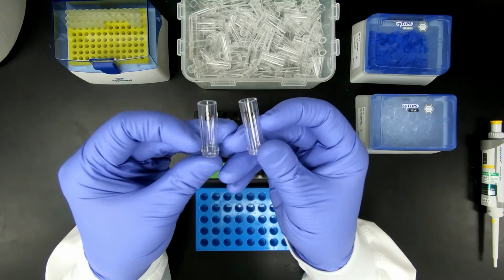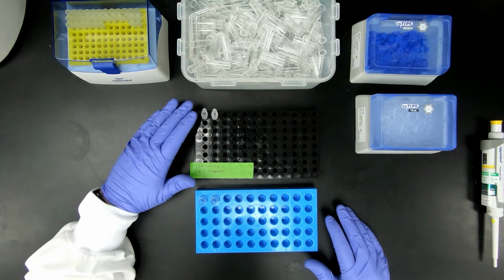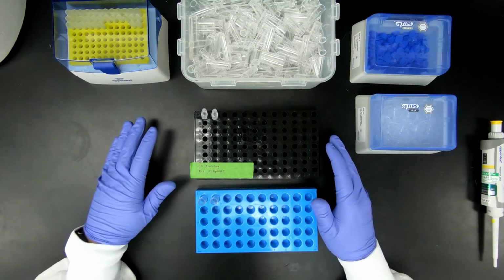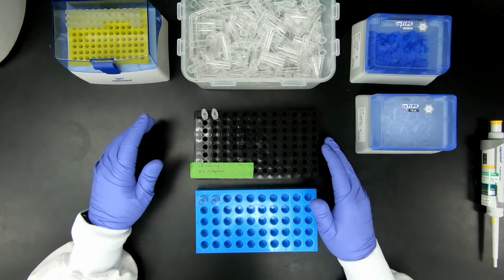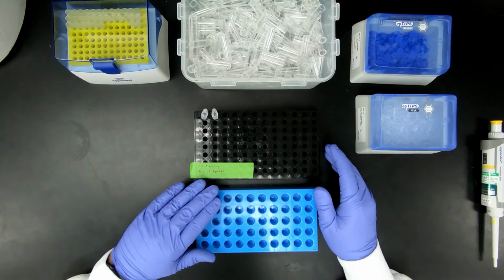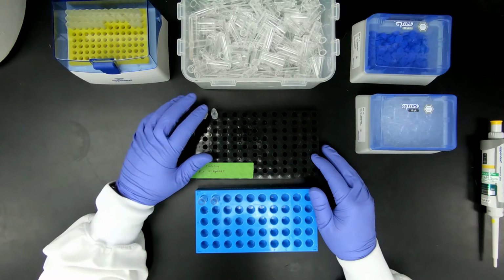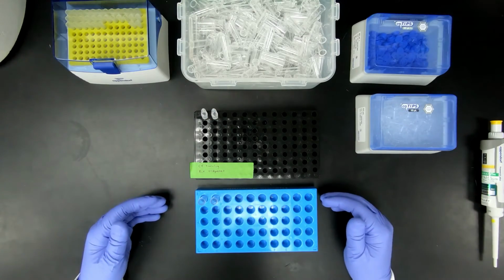Go ahead and pre-label each vial so that you know what they are later on. Just a note, this all needs to be done inside the hood because this has BME in it, and BME needs to always be pipetted in the hood. And since the samples have BME in it, they have to be loaded into these vials in the hood. These currently do not have BME in it. They only have water in it for right now, so that I can just show you an example of how to load the samples.